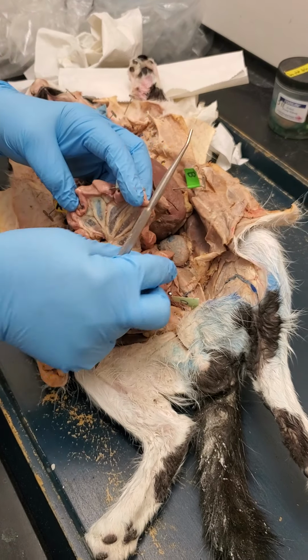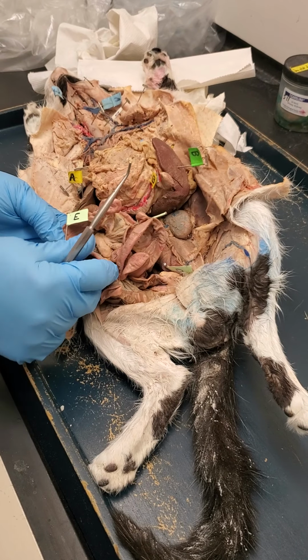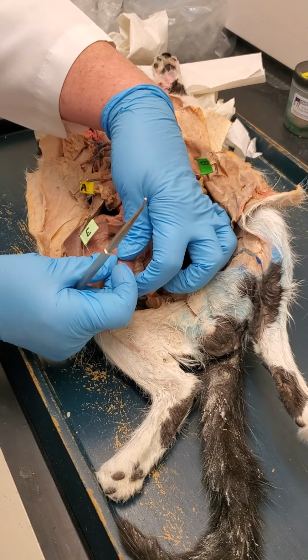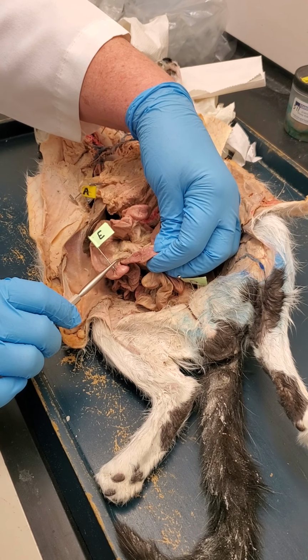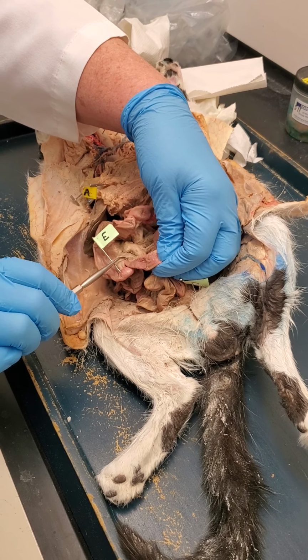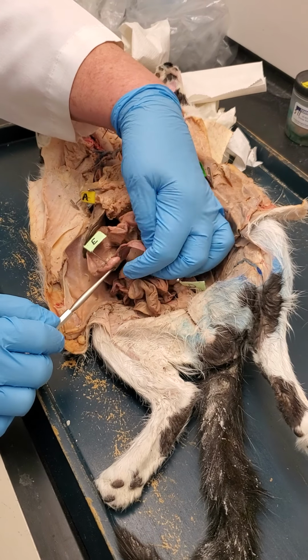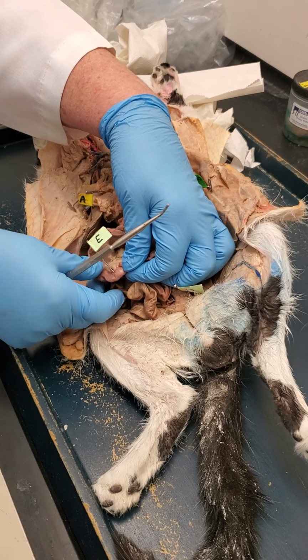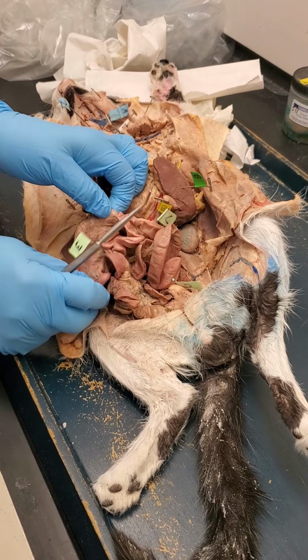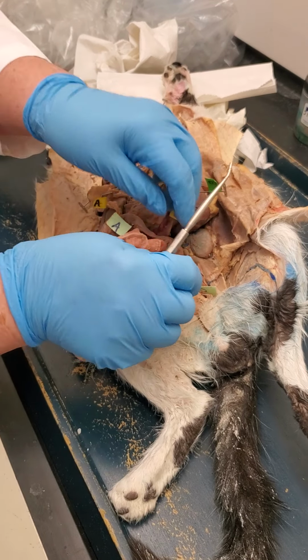Okay. We follow that all the way around to the end. This would be the ileum right here where it ends. And the ileocecal valve would be right in there. I didn't put a pin in it, but I suppose I could. And then here's the cecum right here. Okay, that pouch. And then, of course, you have the colon, which goes around, down and around.